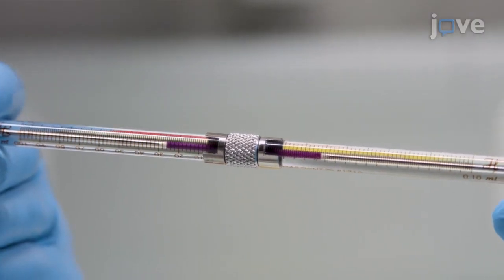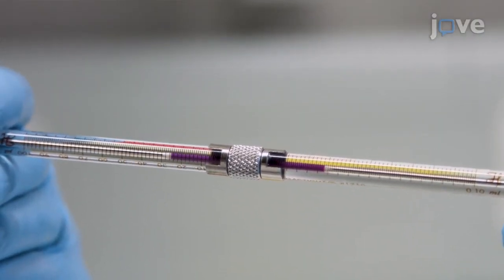Mix in the lipid and paraffin by passing the sample through the coupler multiple times.